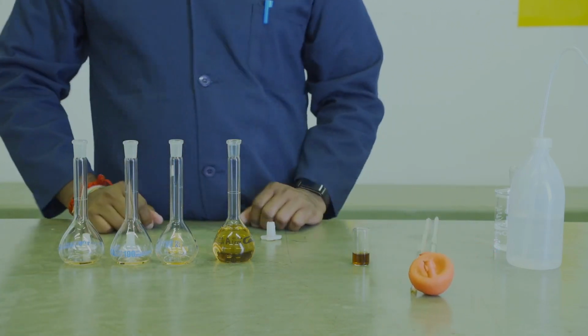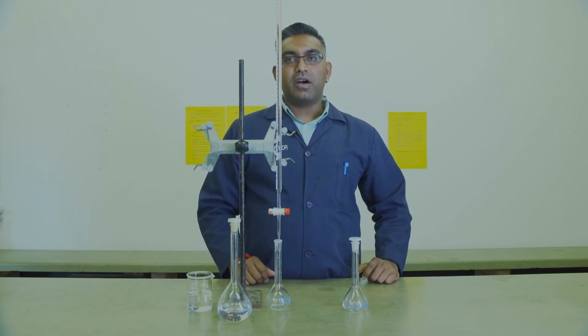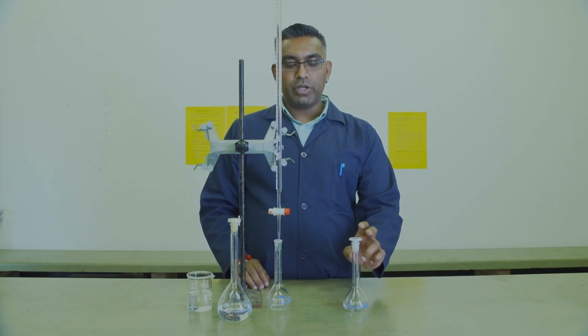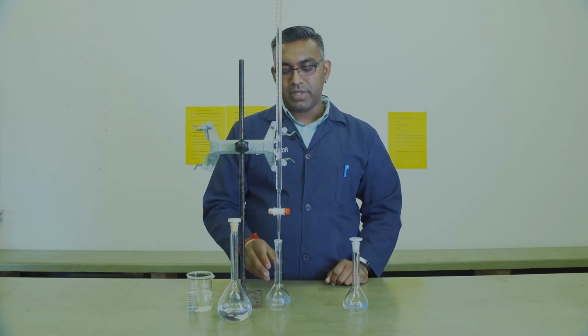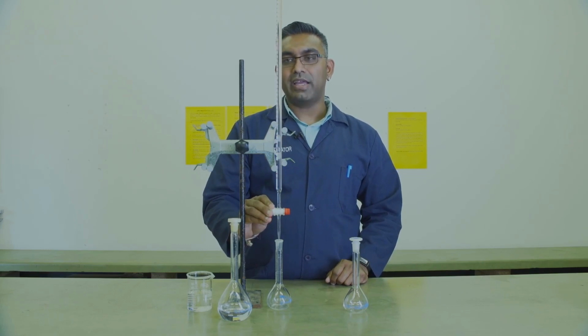You are now ready for the next part of the experiment. You will prepare a burette using your 20 ppm solution of phosphate. Thereafter, you are provided with 6 100 ml volumetric flasks, which you will label 1 to 6. In the first flask, you will not add any of the solution you've prepared. Into the second flask, you will then add in 8 ml of your phosphate solution using your burette.